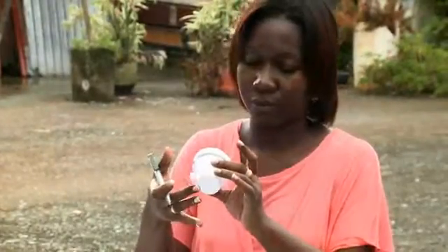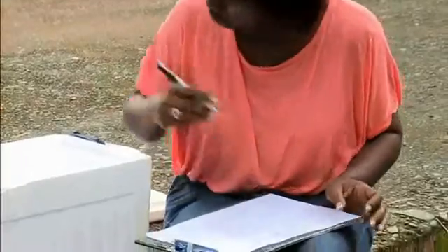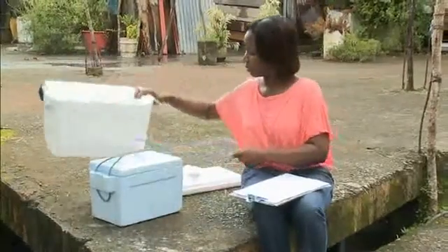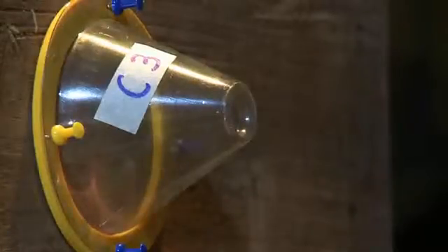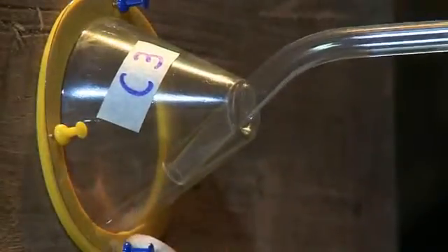After 24 hours, count the number of mosquitoes dead and calculate percent mortality in both the exposure and control. If necessary, repeat the experiment on different wall surfaces. In each experiment, use the same number of mosquitoes for exposure and control.